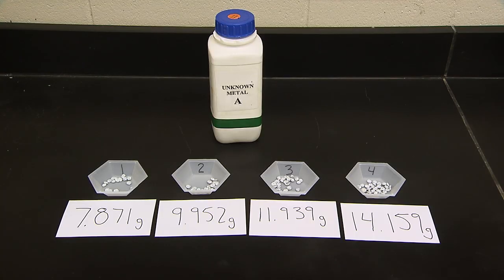Remember, you can always remove sample from the weigh boat if you add too much, but never return the chemical to its stock container. Just remove it to a different weigh boat and use that when you get your next sample. At the end, empty any extra into the waste container. Watch the How to Use a Digital Balance video for more detailed instructions. Notice that the masses aren't exactly as listed on Table 3, but they are close, and we recorded all decimal places shown by the digital balance.